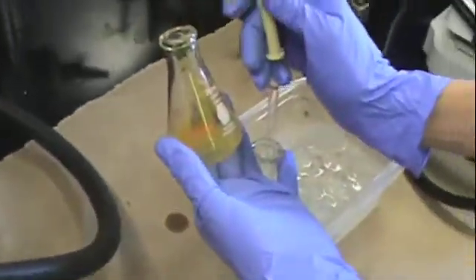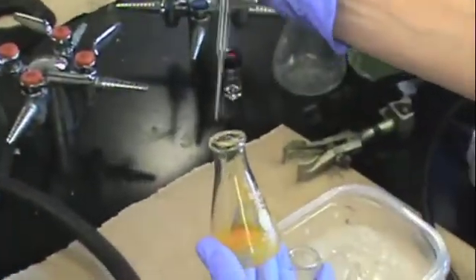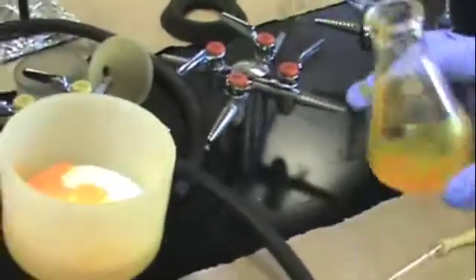Then what you will do is use your cold solvent to rinse your flask so that you can filter the remaining crystals in your Erlenmeyer flask. Swirl and pour into the funnel onto the filter paper.